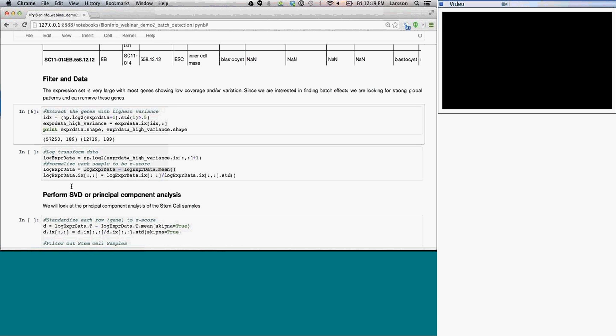The only reason I asked is that theoretically you're looking at genes with probably an FPKM greater than 3, for example, and you will impact the fold change, but with higher expression genes, it's going to be less of an issue with adding one. But I just wanted to bring that up for folks that were listening, as that value is potentially important to think about in the future. That's a very good point, and perhaps the more careful solution would be to perform a second filtering on FPKM as well. So we're only looking at those genes where the FPKM is above a certain threshold for a certain number of samples, and then we'd reduce the effect of this.